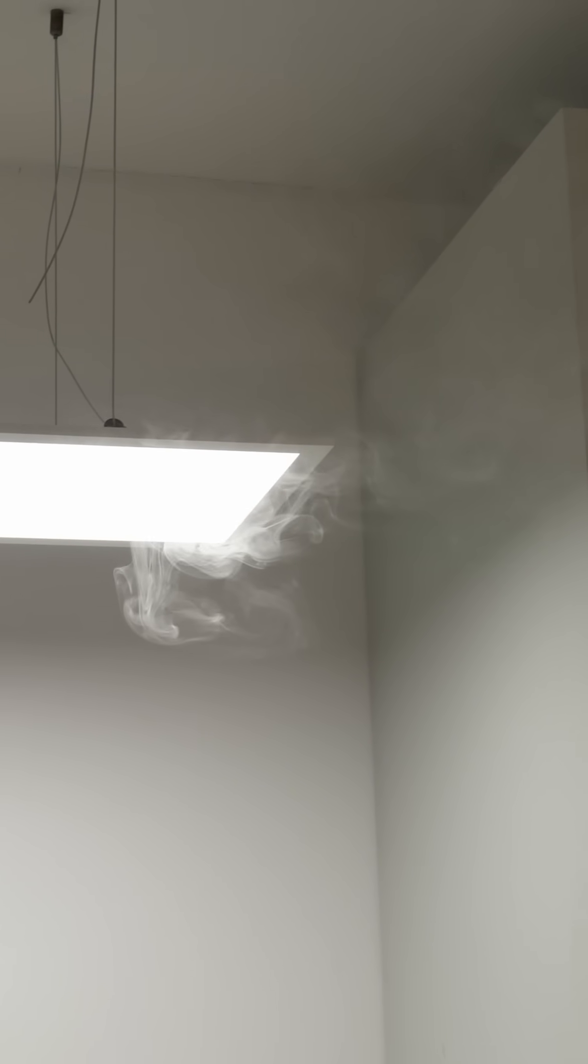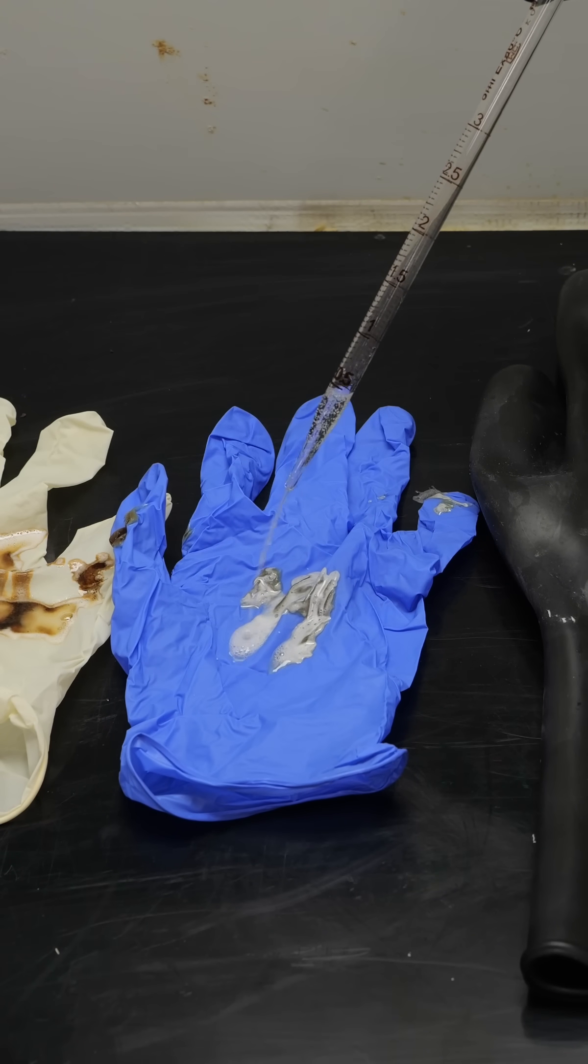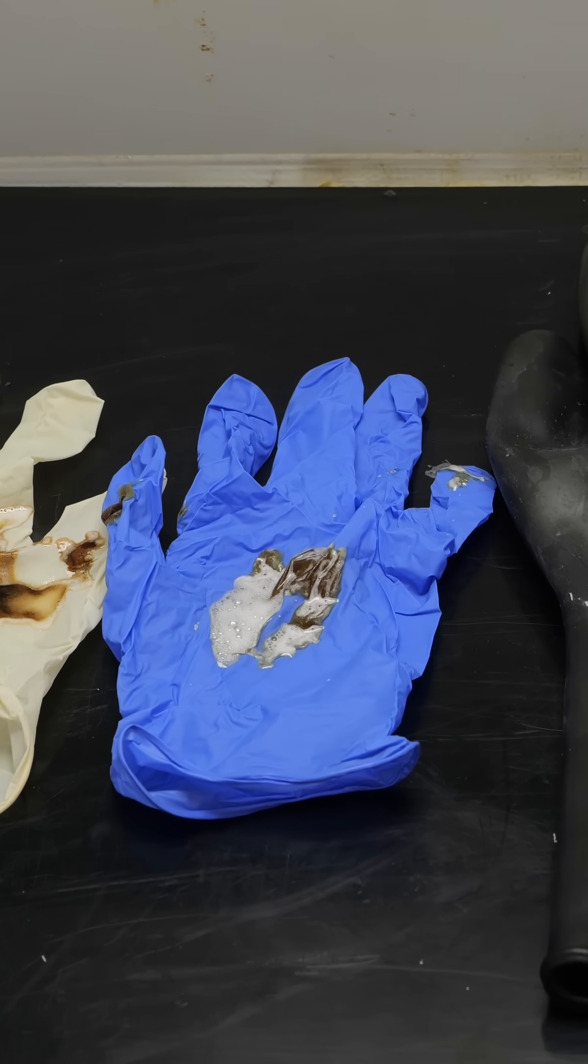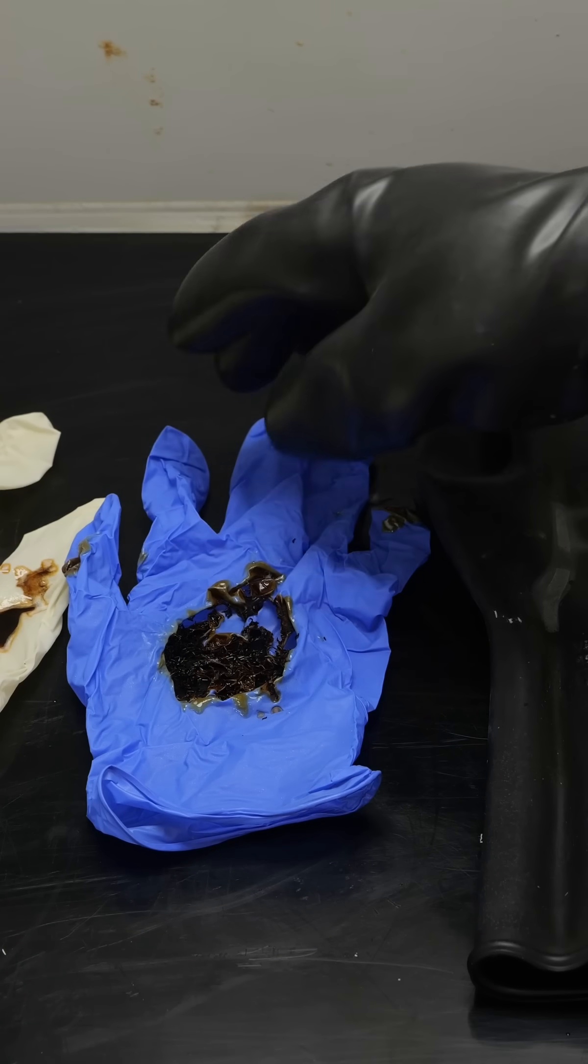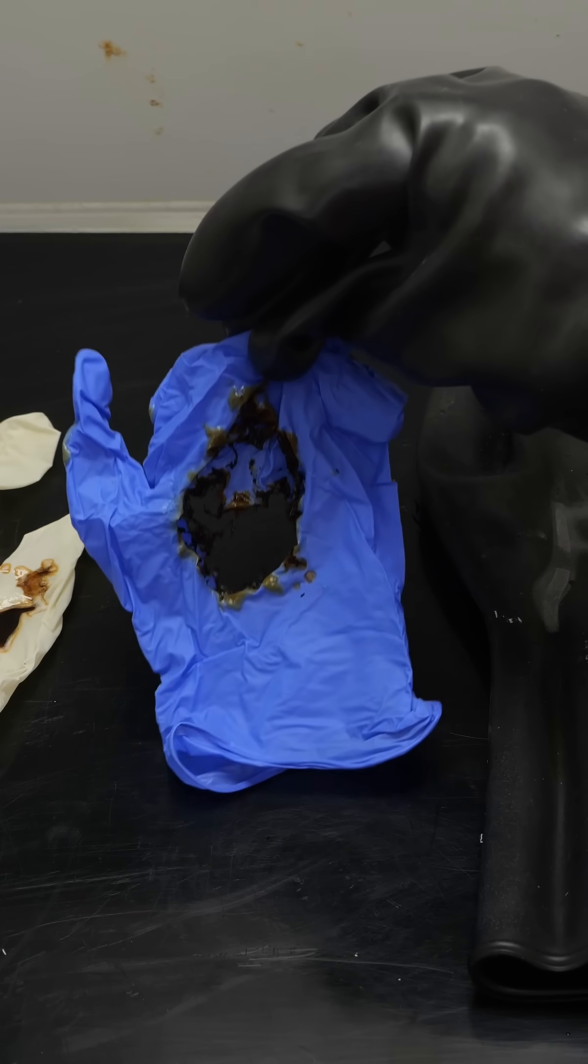Sulfuric acid mist forms in my fume hood, it's really best not to breathe it in. What really stands out to me is how piranha acid destroys protective equipment completely. Even nitrile gloves, which are really standard protection in the lab, get eaten away in no time at all.